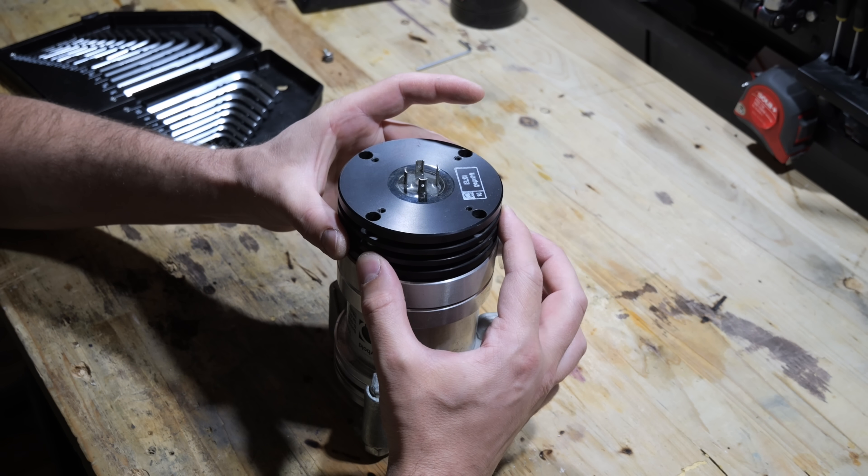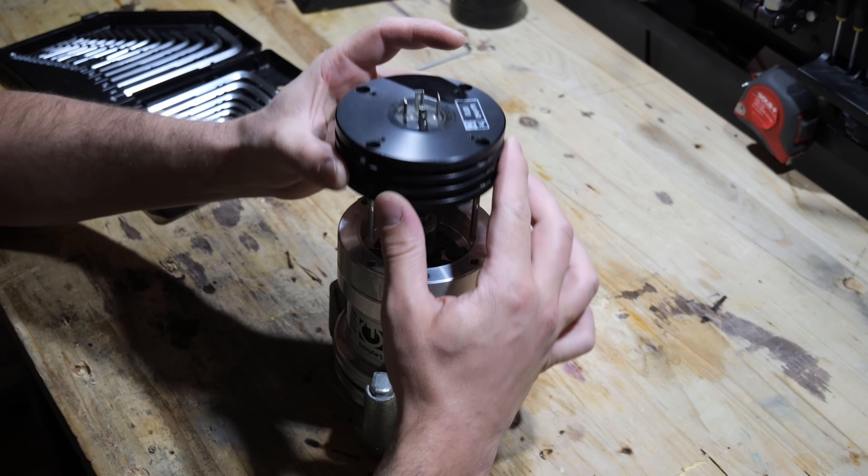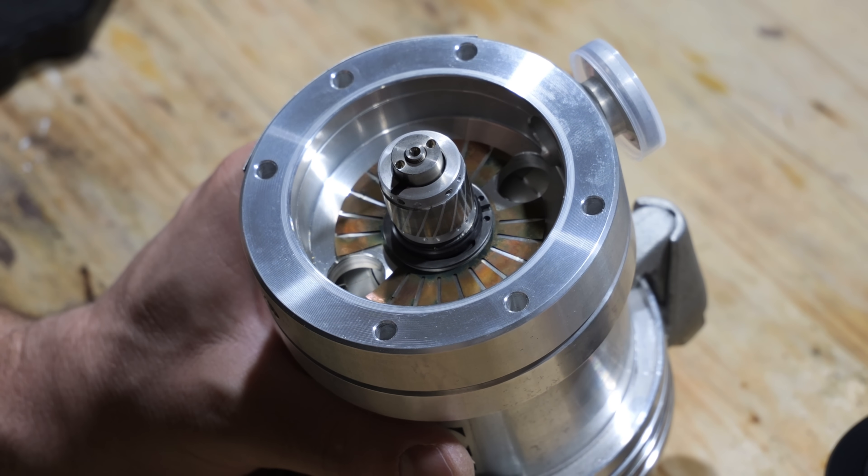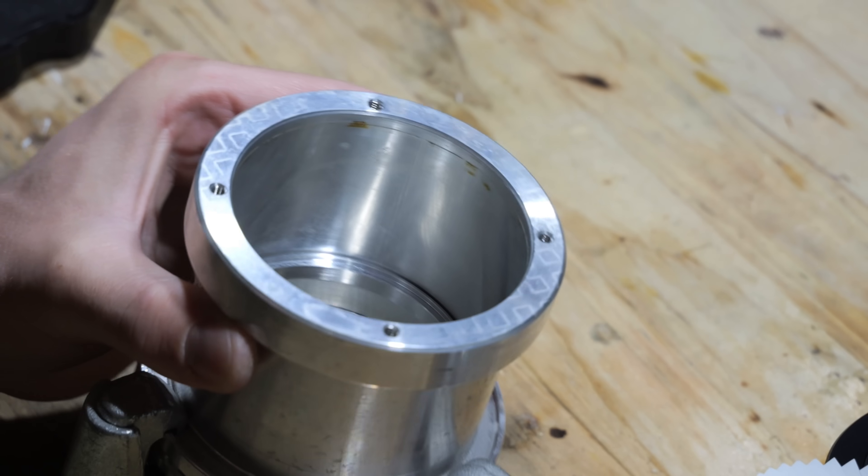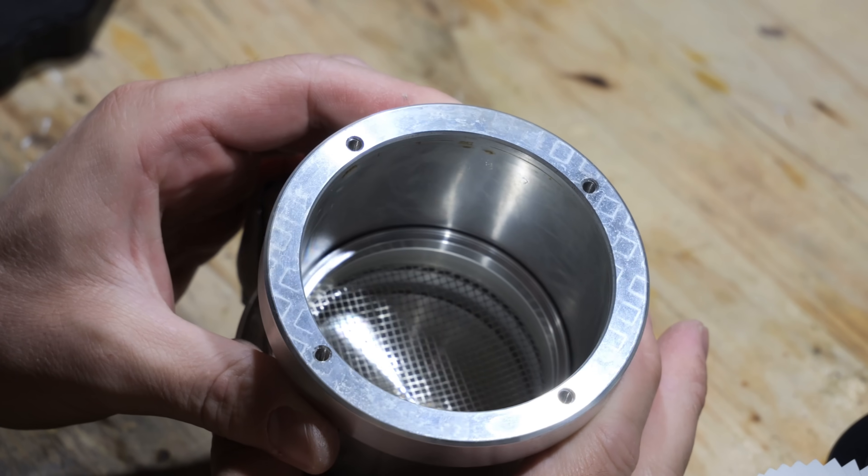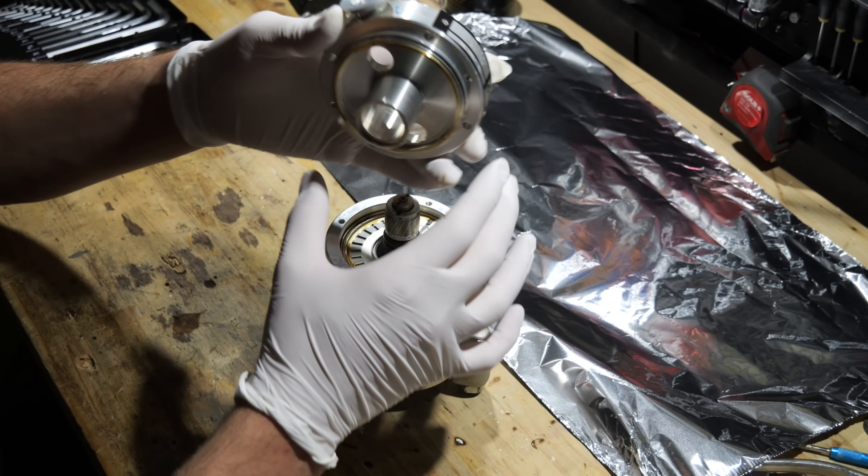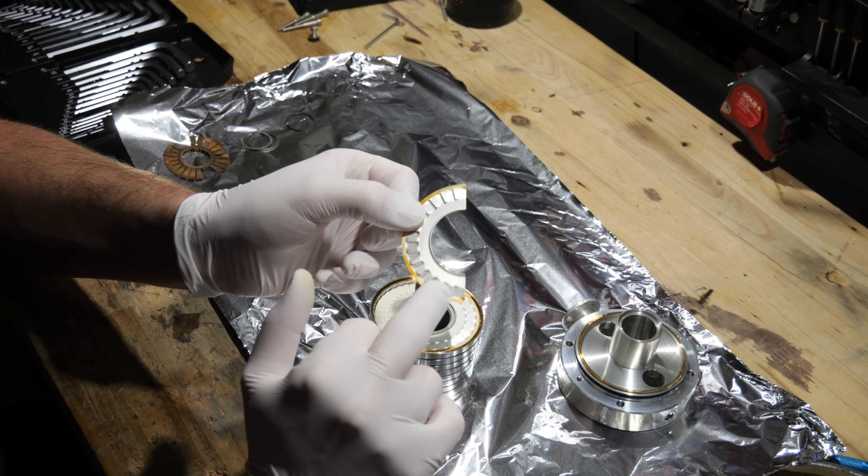Hence I decided to open it up and assess the internal condition. After removing the lower part you can see that there's visible corrosion and some contamination on this copper part. Inside the casing you can see even more contamination. And after removing the rotor and the stators you can see that there's old oil residue.